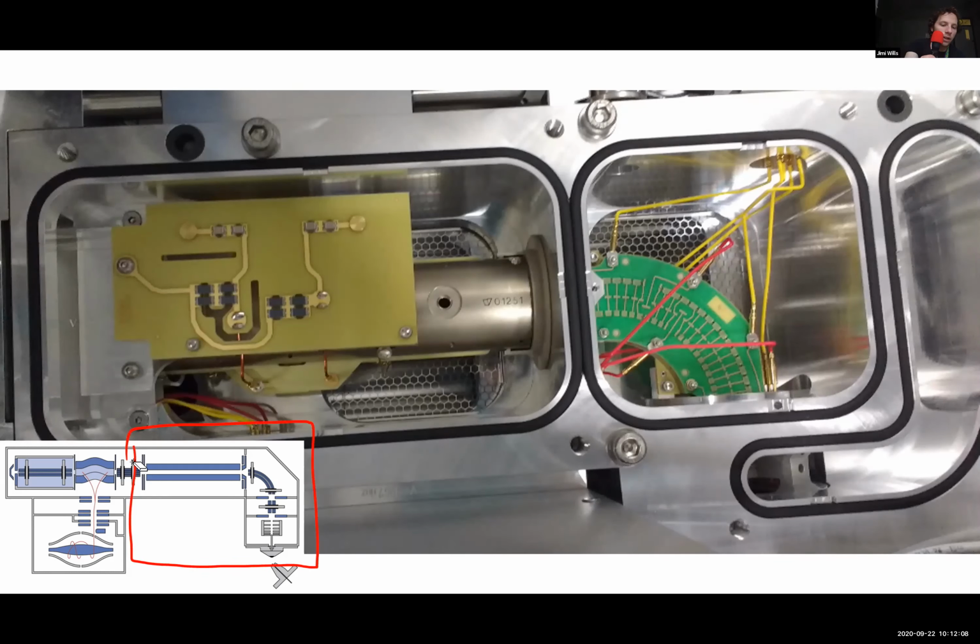Well, no, it's not actually, is it? This is the area we're talking about. So this little bit on the corner here is this bit here. And this is called a bent flatapole on this instrument. On the Fusion Lumos, it's called an active beam guide. The point of it is, I guess there are 2 points. One is to control the form factor of the instrument. So if you can redirect the ions in a different direction, you can squeeze your components into a smaller bench space. But also anything that's not charged will now just hit the back wall, which means you're not filling any further into the instrument with stuff that you can't manipulate.